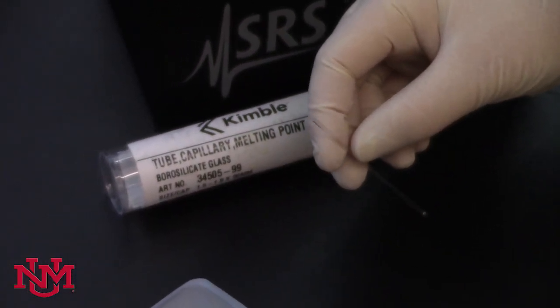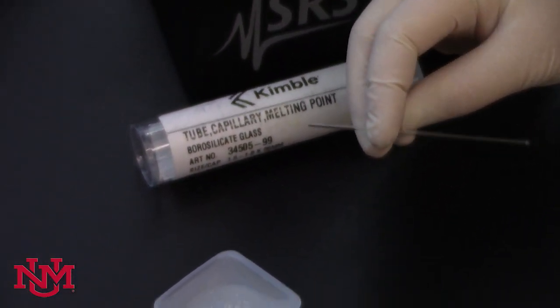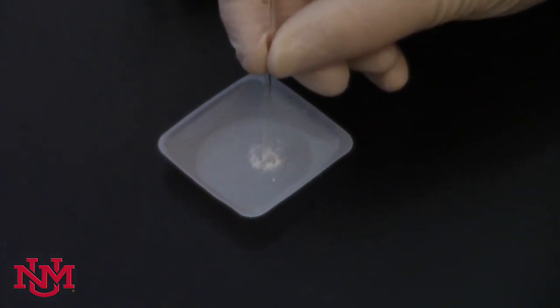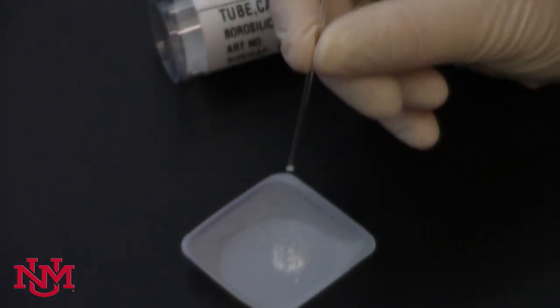Take the open end of your capillary tube and tap it gently into the sample. You just want to take a tiny little amount in there. You don't need too much for a sample.